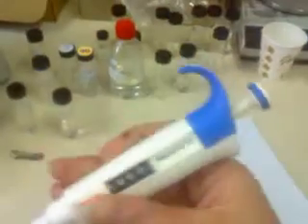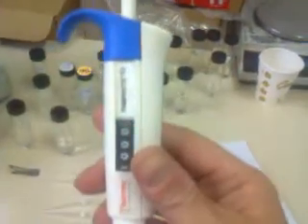I thought I'd take the time. I'm here in the laboratory, as you can see, with all kinds of chemicals and stuff. I have what I call a pipetor, which can measure a volume of — in this case — water.